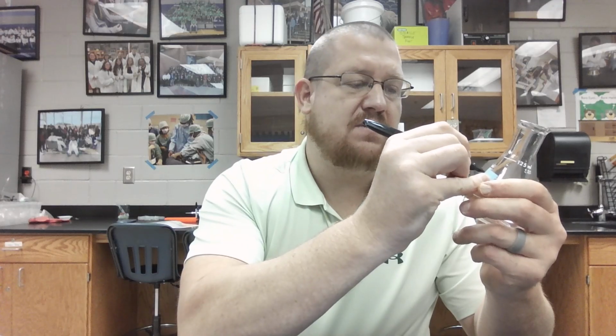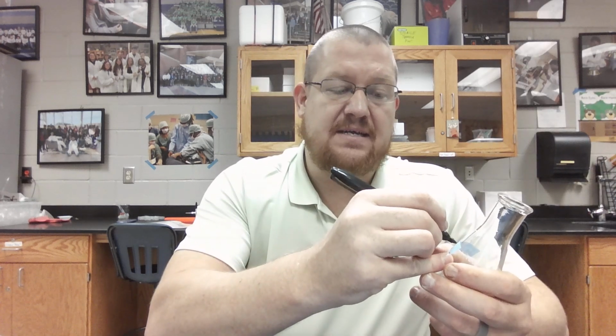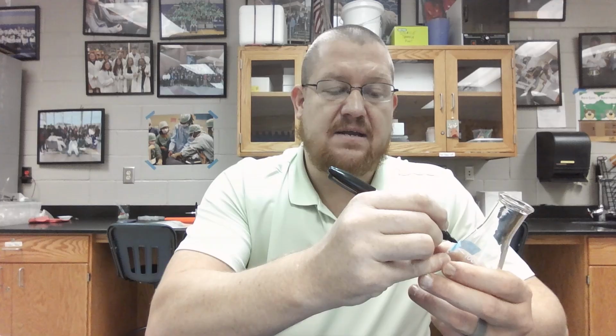Next up, we're going to identify our solution. We're going to start with the concentration that we identified here as 0.1 molar. So I'm going to put 0.1 capital M for molarity. So we have our concentration on now. And then next would be the chemical identity, which is NaOH. I would not have had room, at least the way I write, to write out sodium hydroxide in whole, which would have been acceptable. So I just used the chemical formula there.